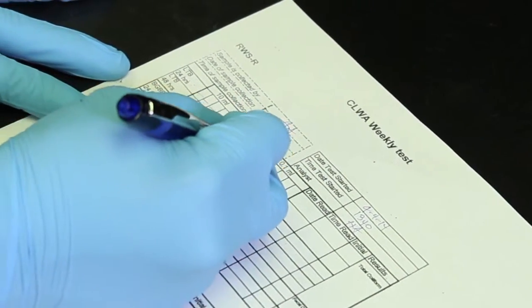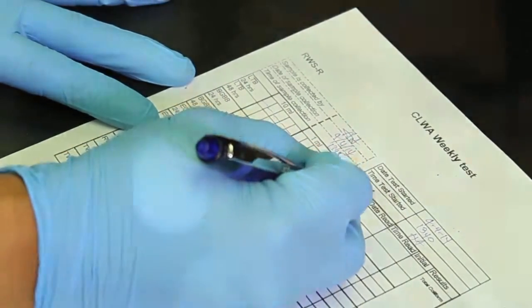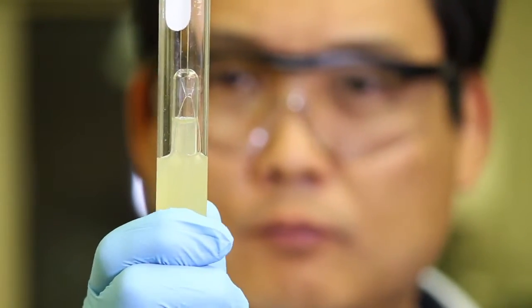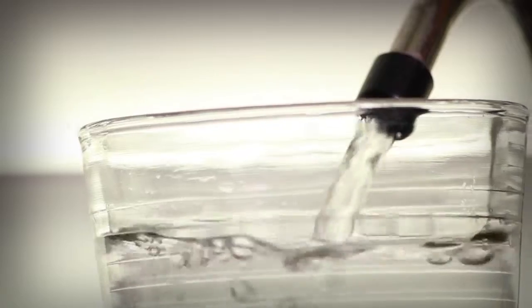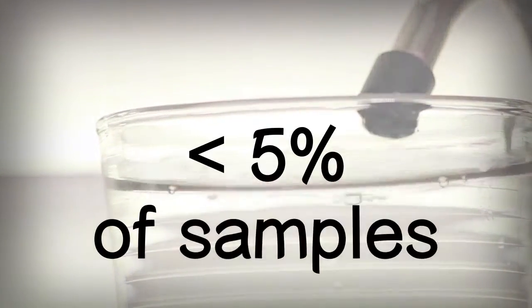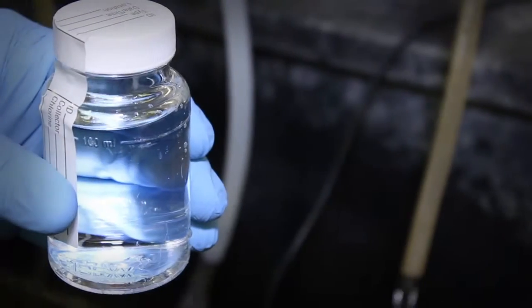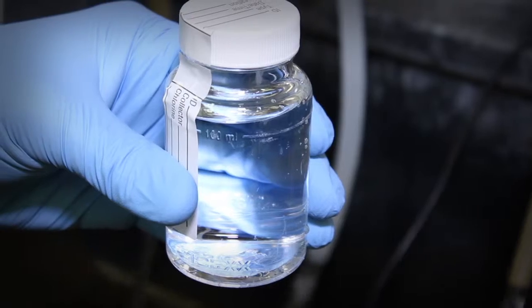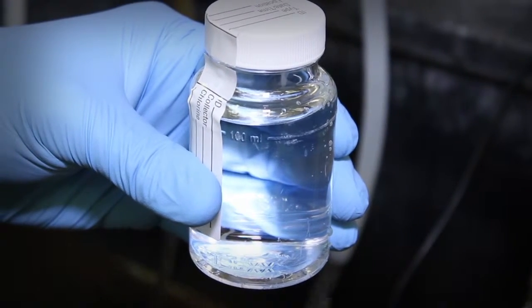After 48 hours of incubation, the results of the presumptive test are recorded. The test tubes are inspected, looking for gas production. In drinking water samples, the actual production of bubbles should be rare, in less than 5% of samples analyzed. If we see no gas bubble, the test is negative for total coliforms. At this point, our water is considered to be free of pathogens as well, and no further analysis is required.